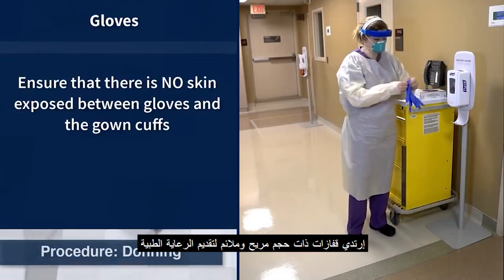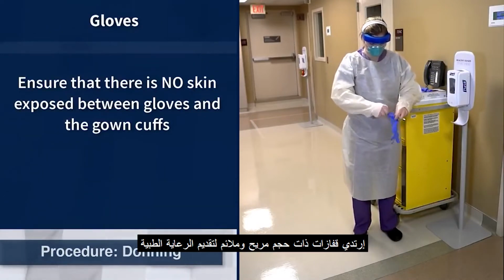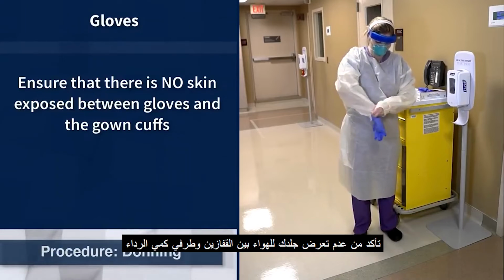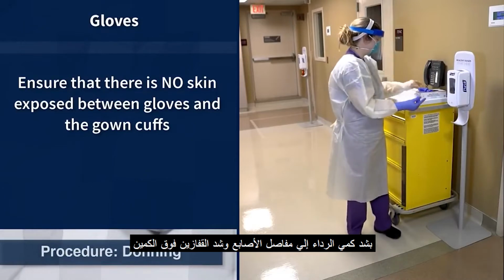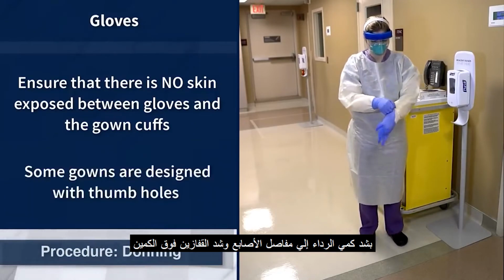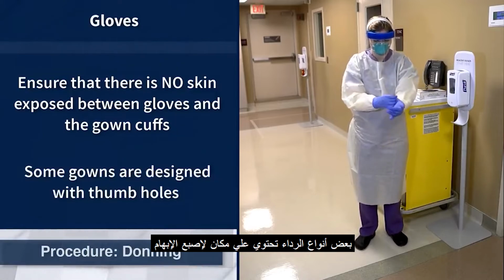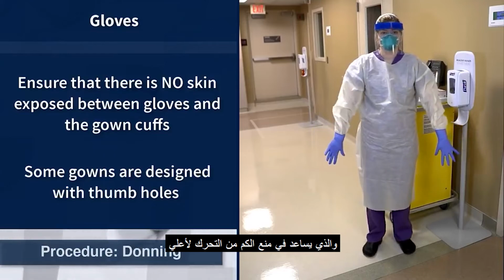Don gloves in a size that is comfortable and conducive to providing patient care. Ensure no skin is exposed between the glove and gown cuffs by pulling the sleeve down towards the knuckles and holding on to the sleeve while pulling the glove on. Some disposable gowns may have thumb holes that help keep sleeves from migrating upward while gloves are donned.